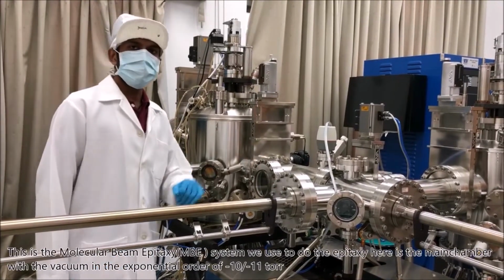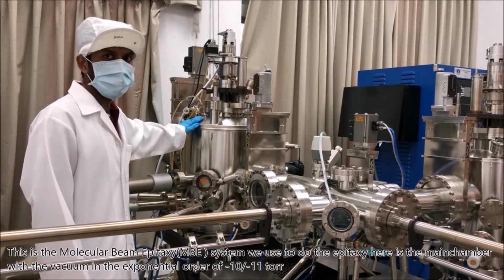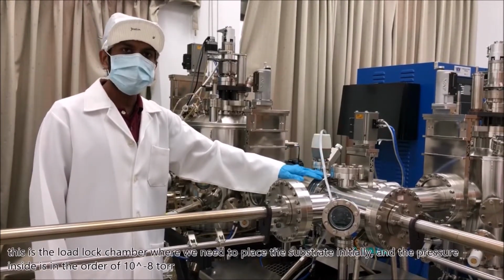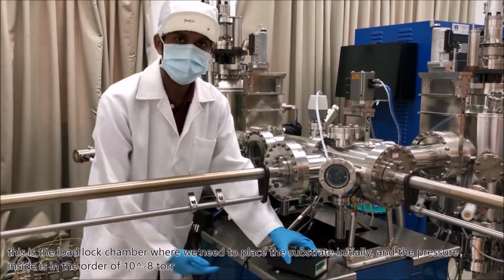This is the MBE system we use to do the epitaxy. Here is the main chamber with the vacuum in the exponential orders of 10⁻¹⁰ or 10⁻¹¹ torr. This is the load lock chamber where we need to place the substrate initially, and the pressure inside is in the order of 10⁻⁸ torr.